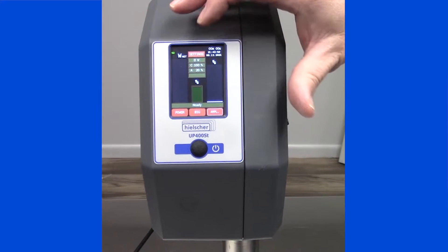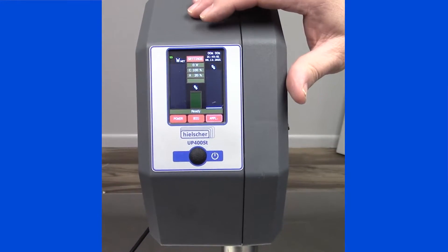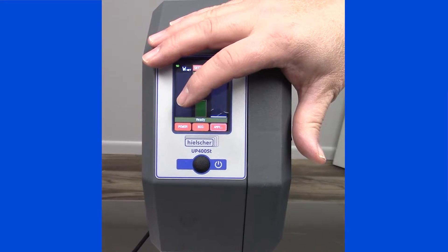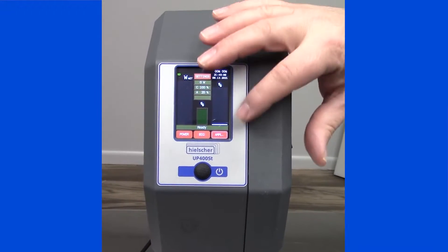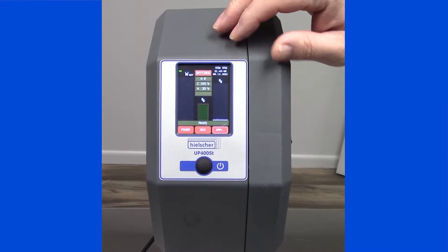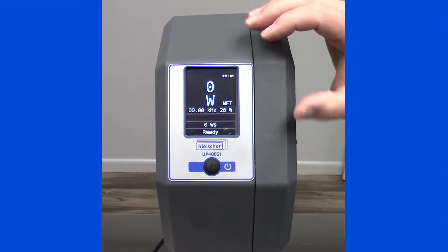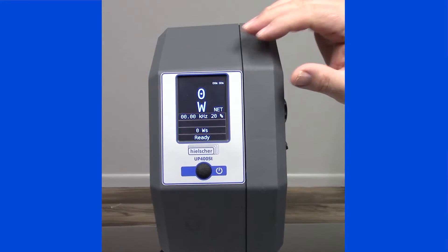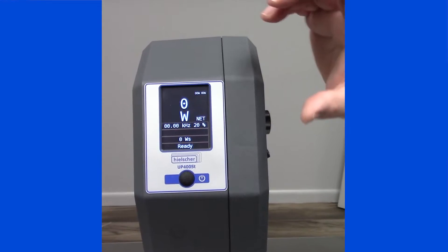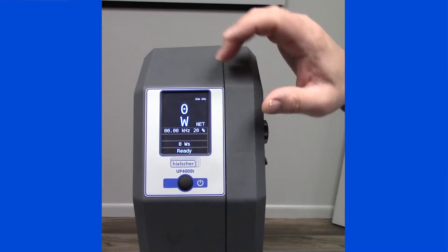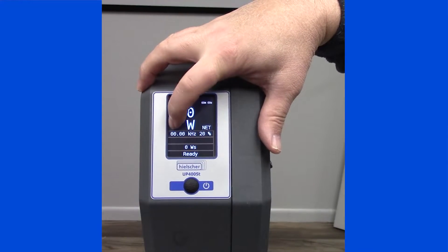Please note the three buttons on the bottom. PWR standing for power, BIG, and AMP standing for amplitude. BIG changes your display so you can see the overall net watts number in a larger format. To toggle back to the primary screen, just tap anywhere in the black.